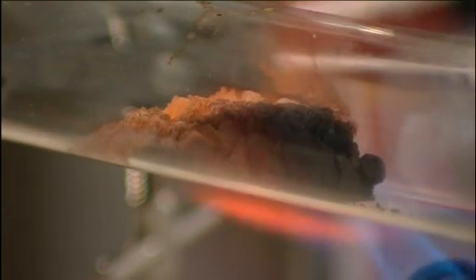Use the Bunsen burner to chase the glow along the length of the oxide until all the black copper oxide has been changed to pinkish copper. This will take up to a minute. When no trace of black remains, continue to heat for at least a further minute to ensure that all the oxide on the inside of the heap has reacted.